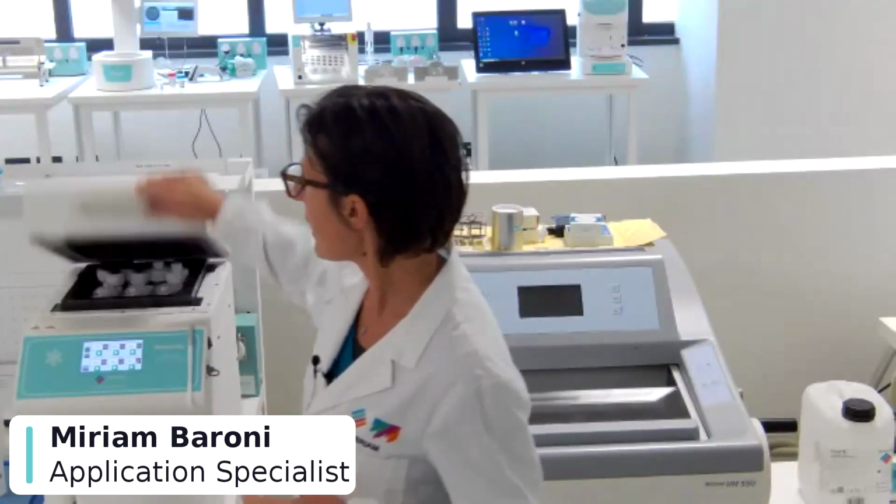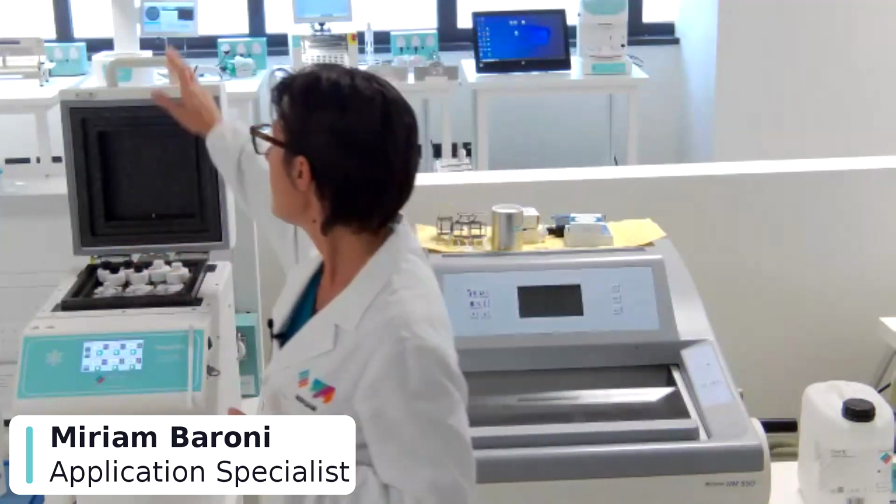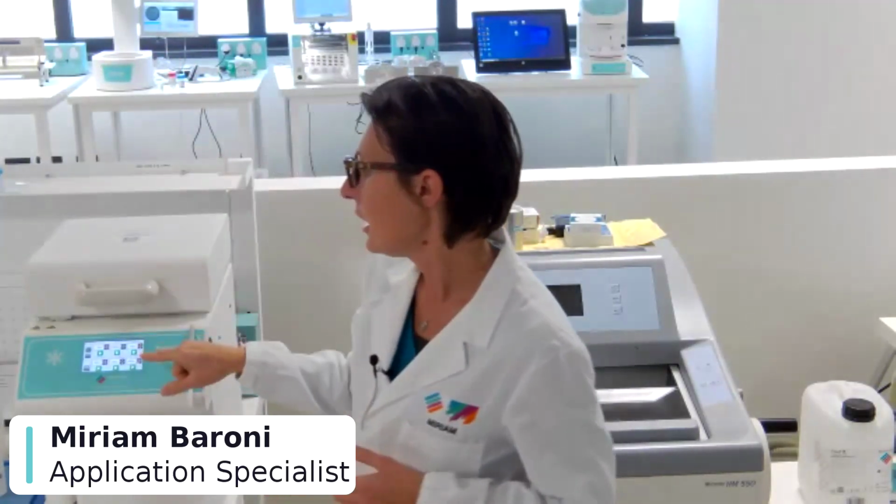Other reagents that we use are for cleaning the instruments. Normally, if there is a sample with a contaminant, it's important to decontaminate and clean the working area. We have a function in the system that allows you to heat up the working area to the correct temperature, room temperature, for the cleaning, and any detergent can be used. We suggest to use Supraspore or ethanol 70% to decontaminate.